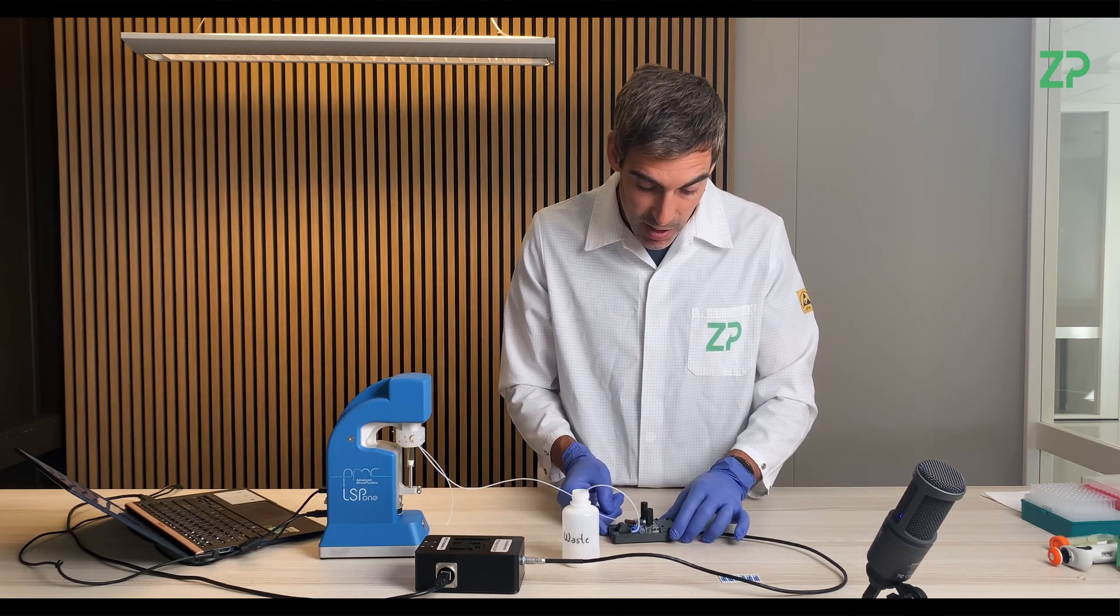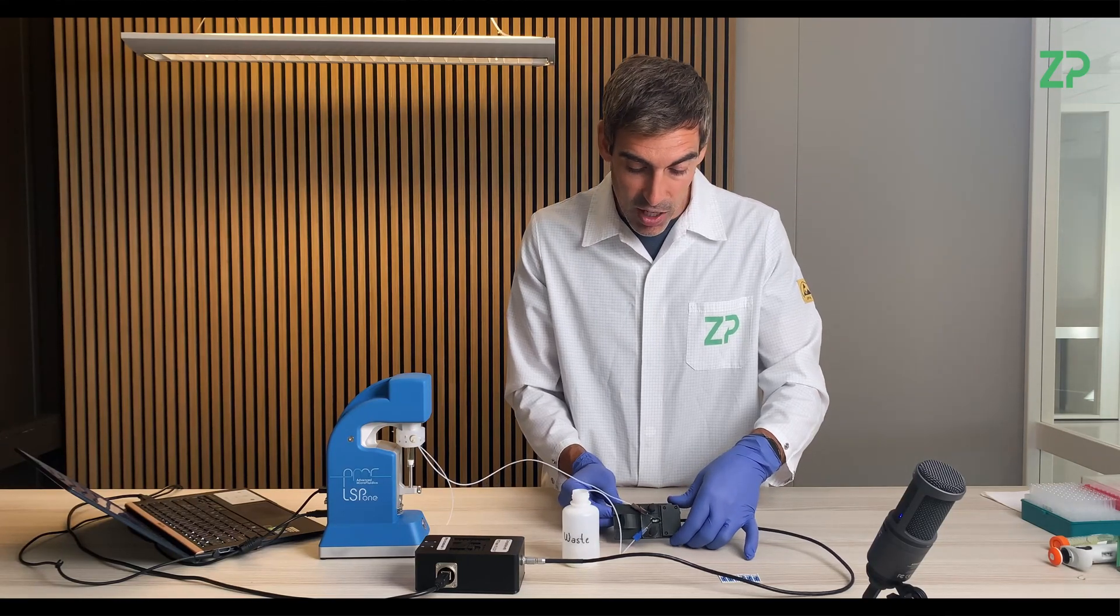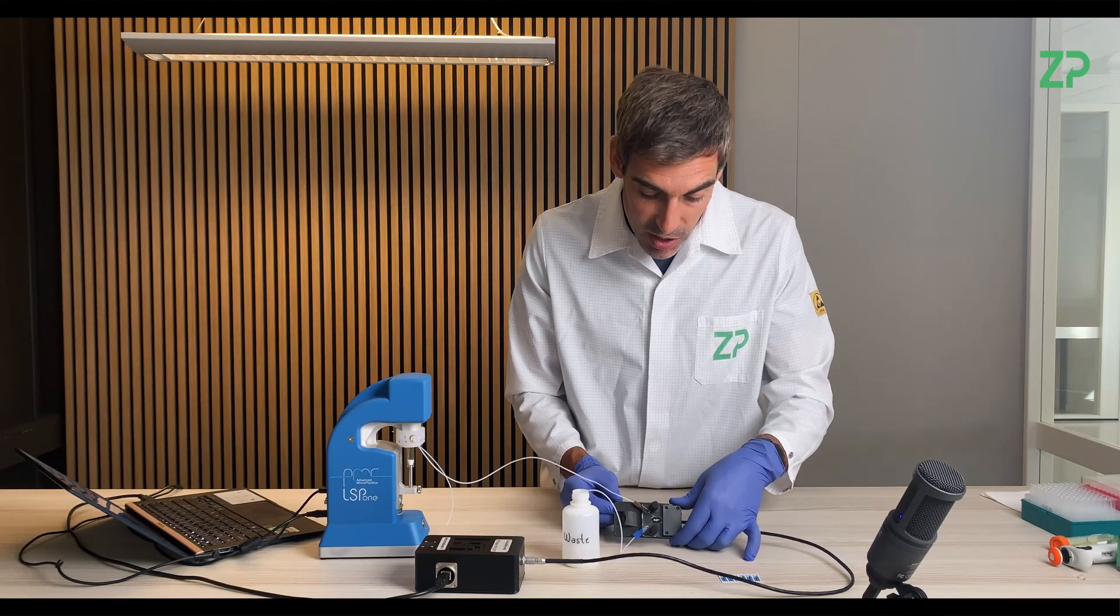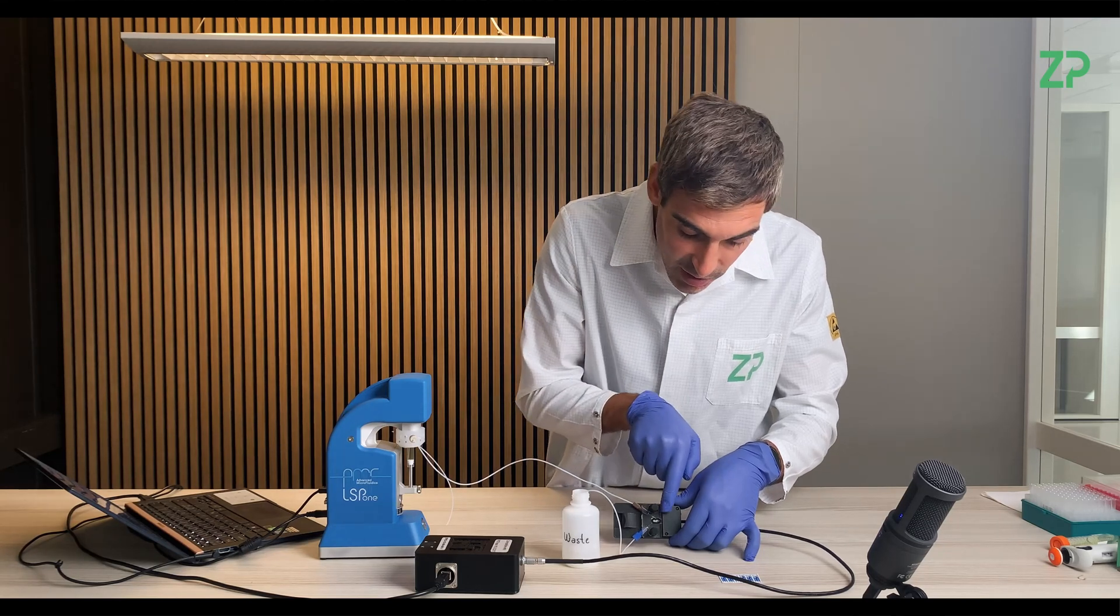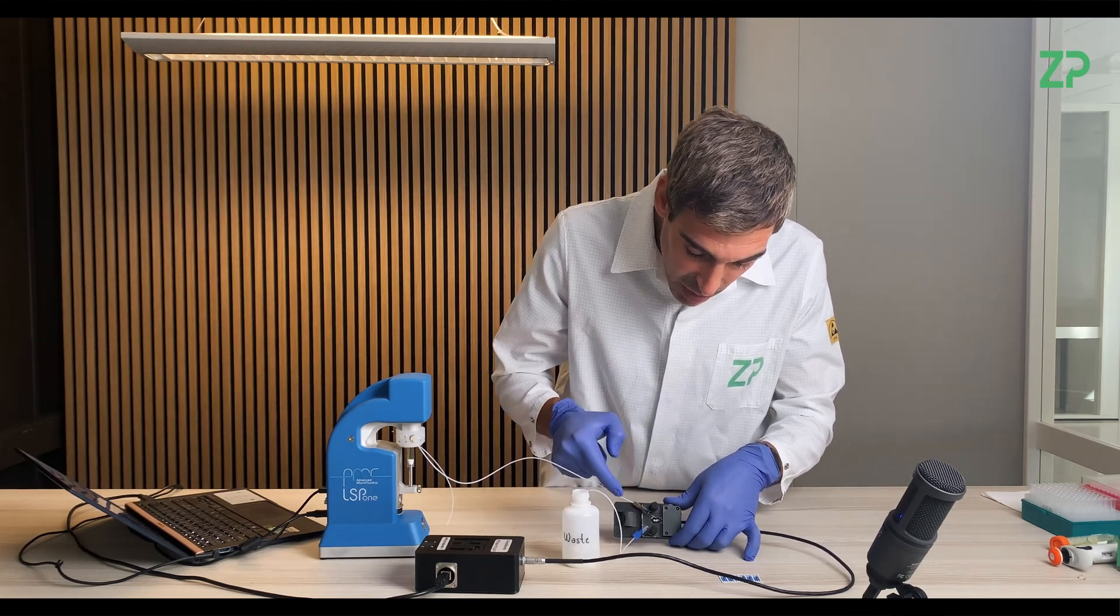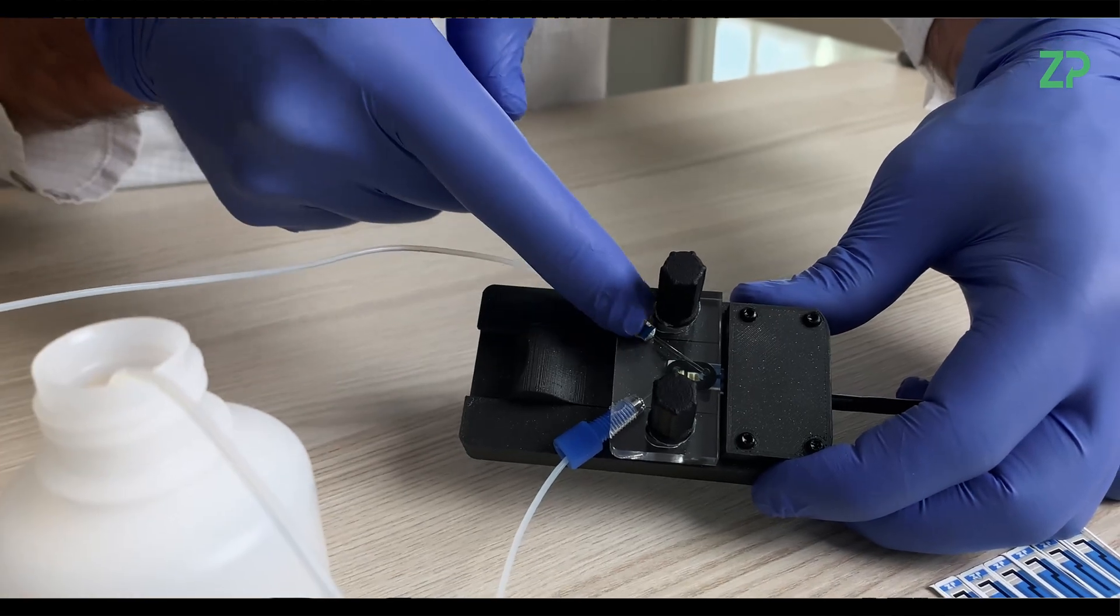It's slightly yellowish, so it will be easy to see. And here I'm just trying to put it a bit sideways so that you can see. It has filled inside the reservoir. It's yellow. It's pumping from this side and pumping out from that side.